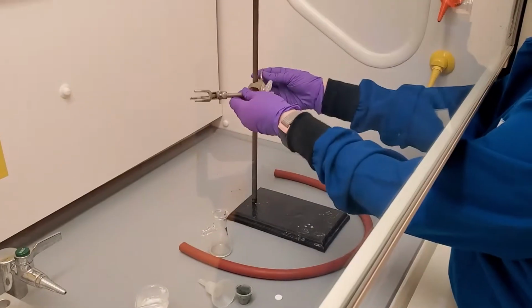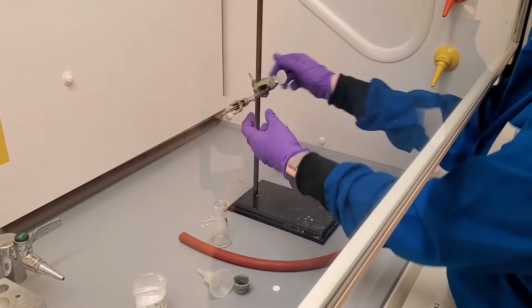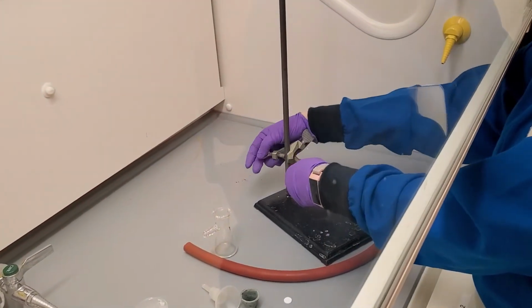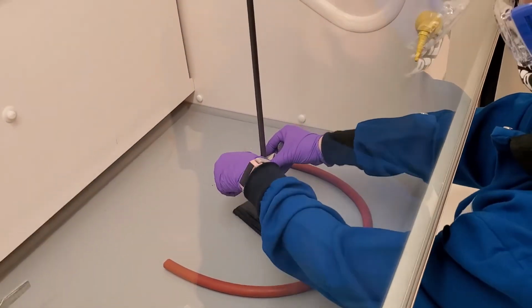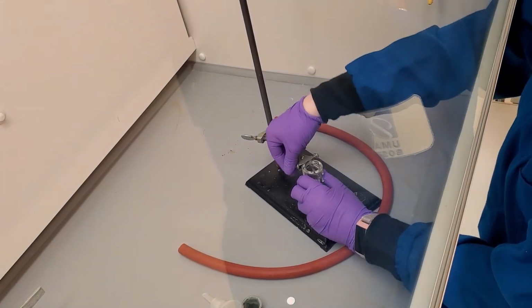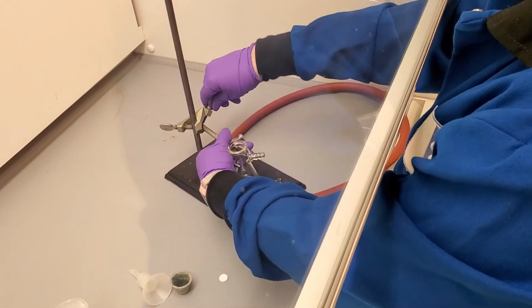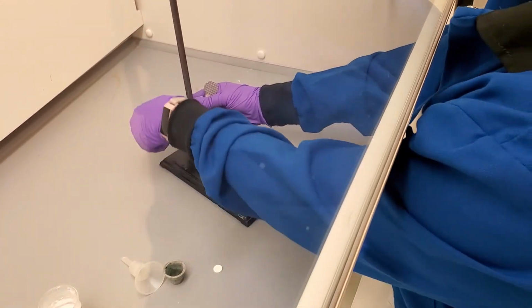In order to remove the water from the salicylic acid precipitate, we need to vacuum filter the crude salicylic acid. First, we must set up the vacuum filter. Use a screw clamp to attach the 3-fingered clamp to the ring stand at a low height. Place the filter flask on the ring stand and readjust the height of the clamp so that it is level with the neck of the filter flask. Screw the fingers in so that they are snug on the neck of the filter flask. You may readjust the height if needed so that the flask is firm against the bottom of the ring stand.